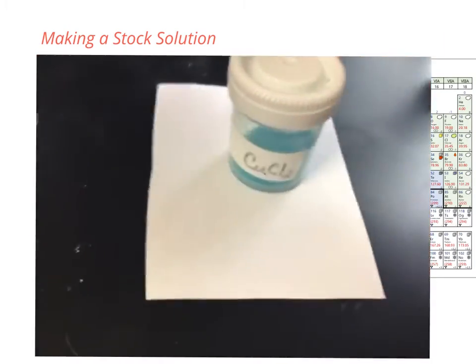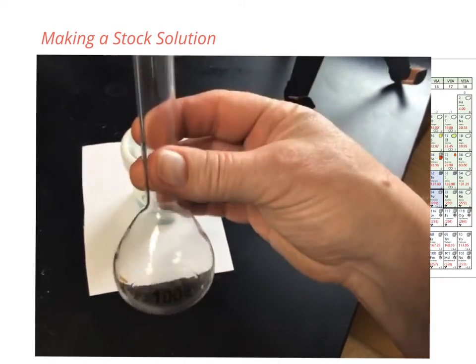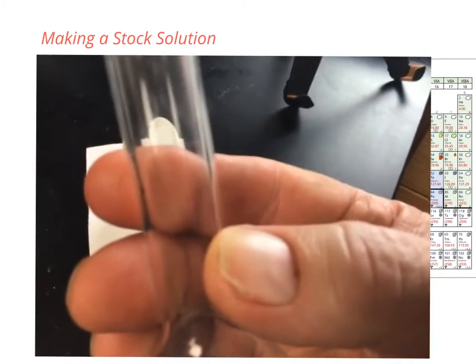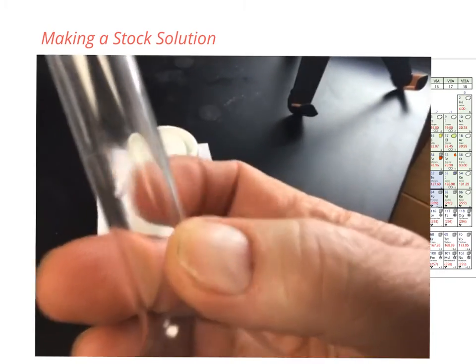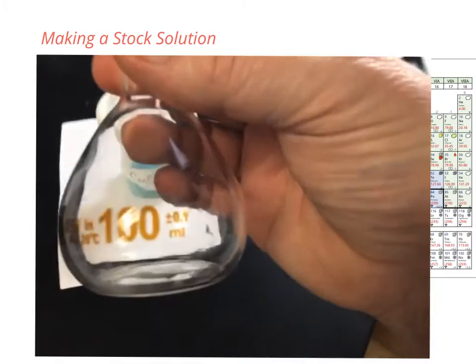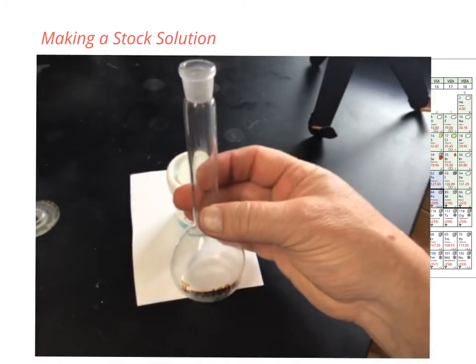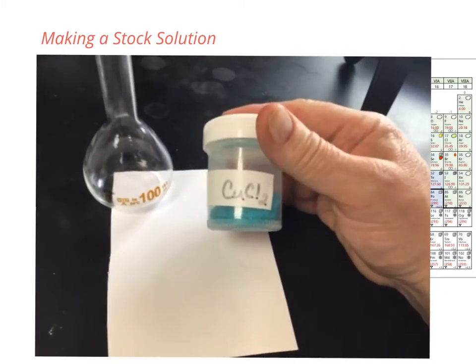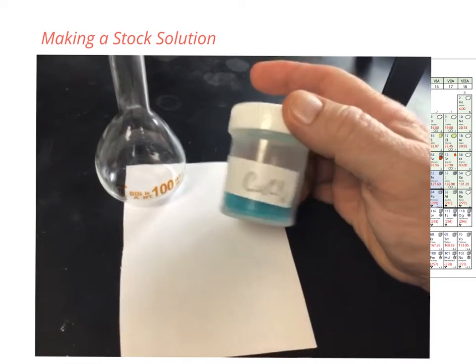To do it, we're going to use what's called a volumetric flask. It is a flask that can measure very precise volumes. On the stem here, there's a line. When we fill exactly up to that line, we will have exactly 100 milliliters, plus or minus 0.1 milliliters. It's a volumetric flask. So we have to figure out how many grams to put in there to make 100 milliliters of a 0.5 molar solution.